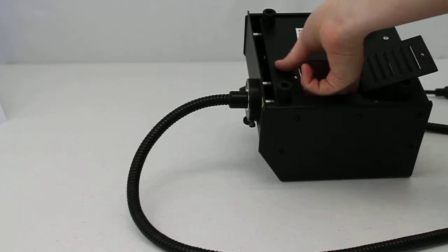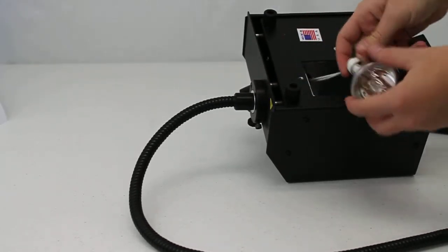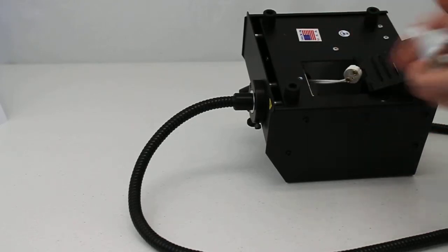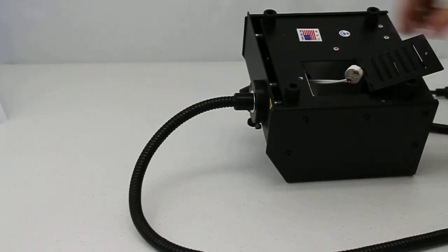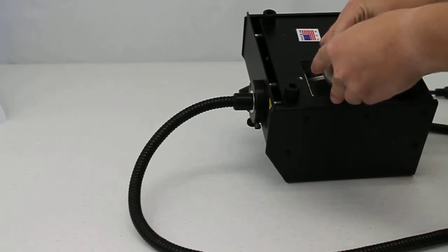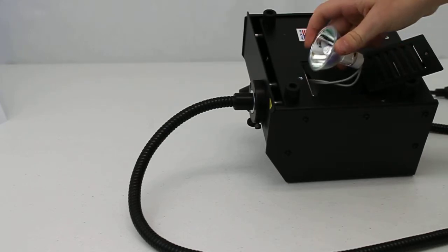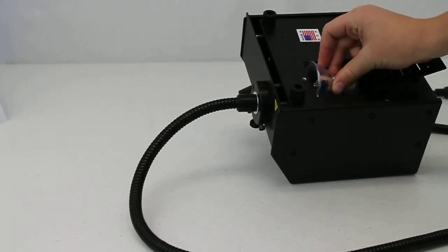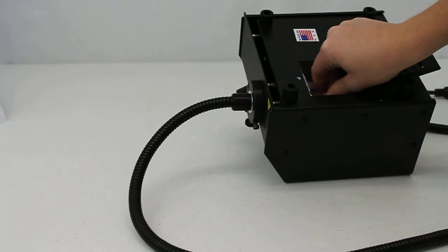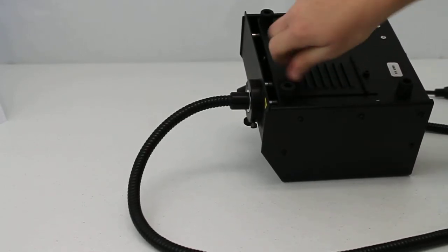Slide the bulb out using two fingers and remove the bulb from the socket. Install the new bulb in the socket, pressing firmly to ensure that the pins are fully seated. Slide the bulb into the housing until fully seated. Close the access door and secure it.